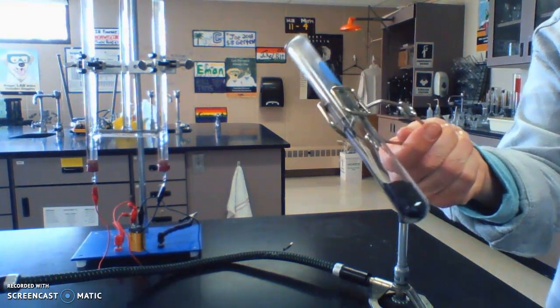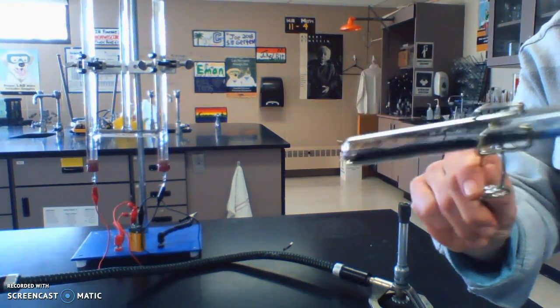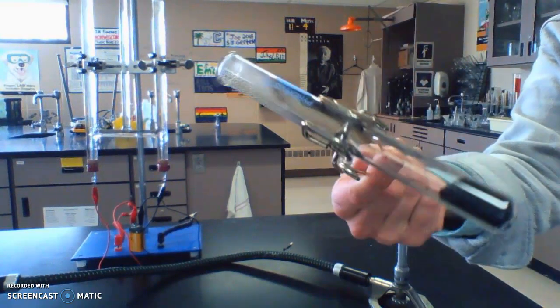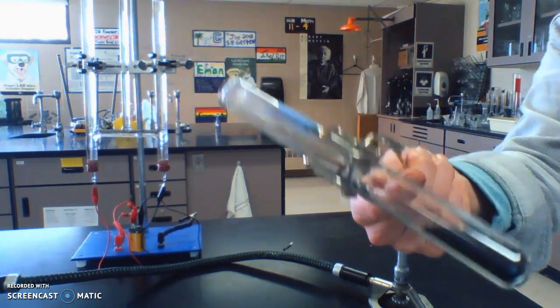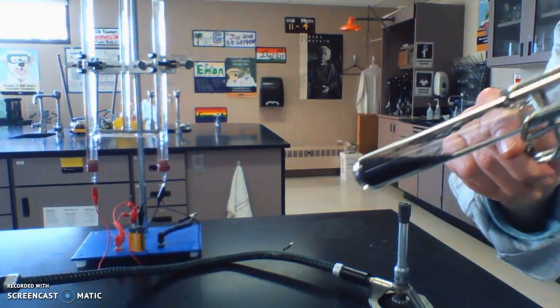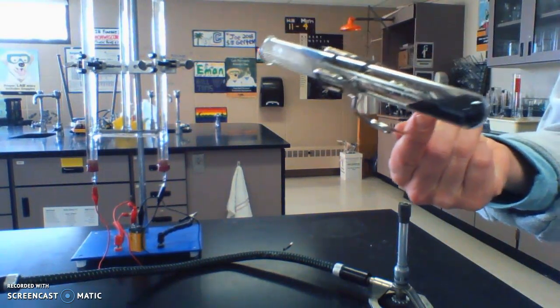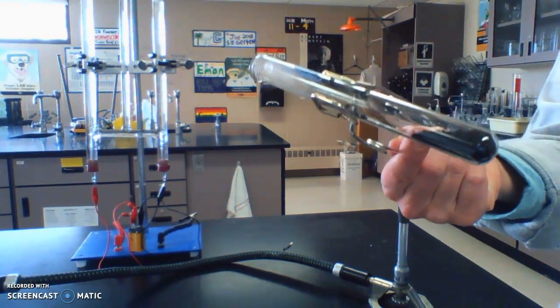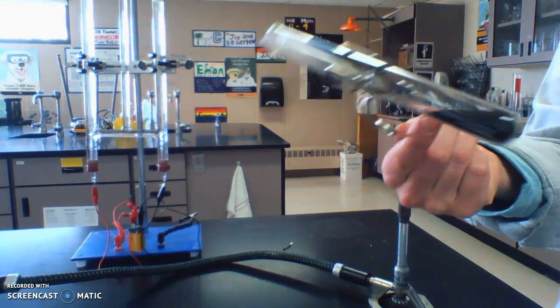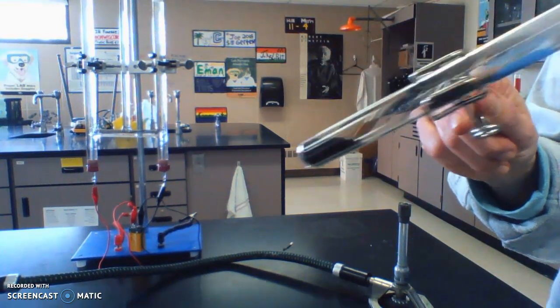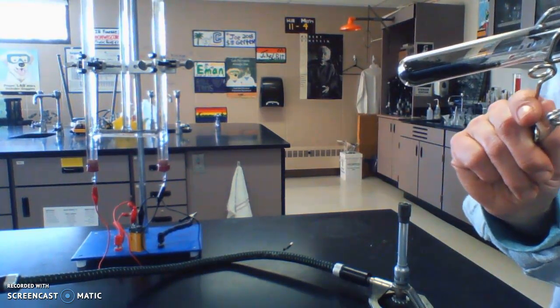I'm going to see what happens in this gas - it goes out slowly. That gas is obviously not oxygen because oxygen would make it continue to burn. That gas is carbon dioxide. If you look at the instructions sheet, you'll see the formula for this black product, copper(II) oxide. We started with copper(II) carbonate and went to copper(II) oxide and carbon dioxide.